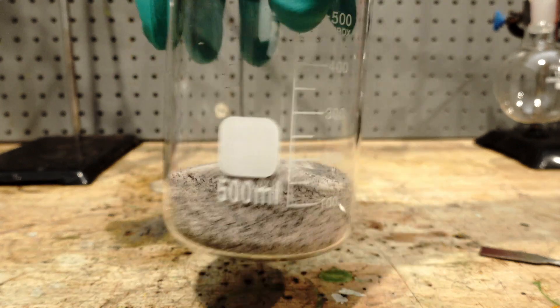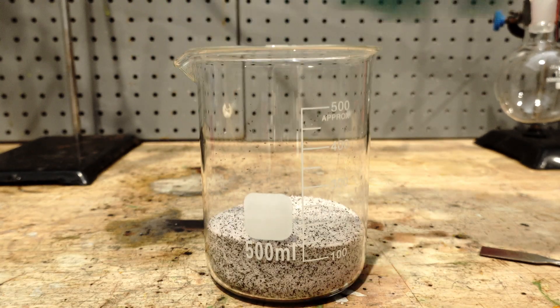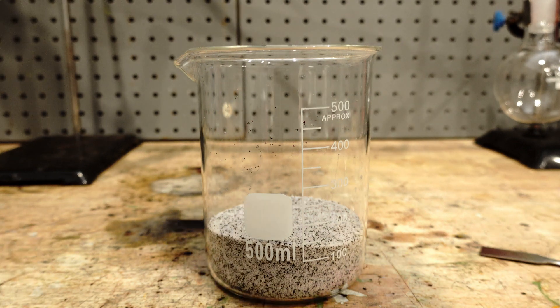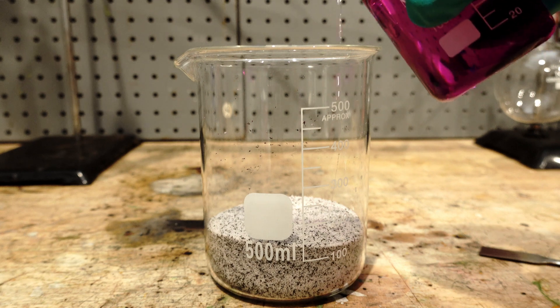To this homogenous mixture, I add approximately 100ml of water. This is to stabilize any manganese heptoxide if it forms in our reaction flask.